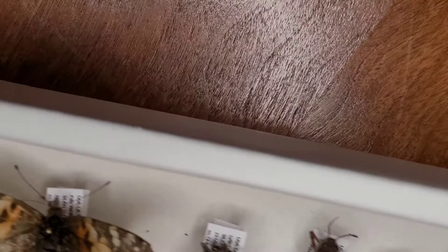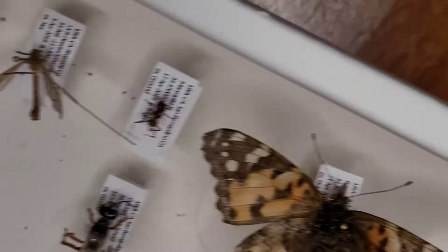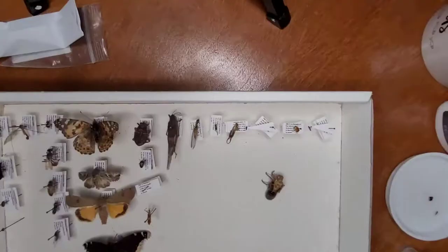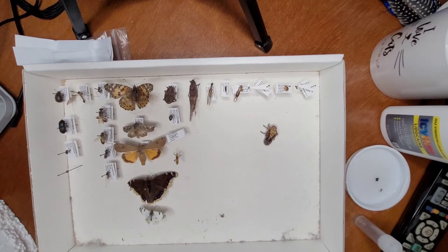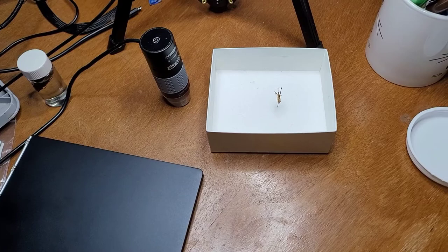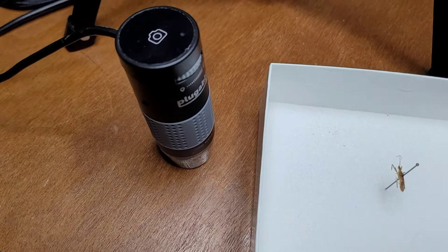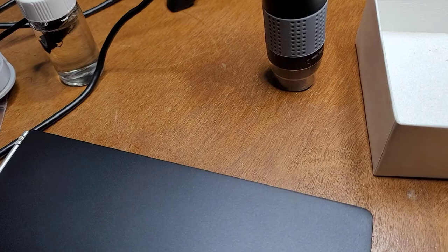These are organized by order and then alphabetically by family — we'll be getting into some of that coming up real soon. For identification purposes I've gone ahead and pulled this out of the box and put it inside a little case with some foam on the bottom. This is the USB camera I'll be using, connected to my laptop. It's not the best camera but it will allow us to get a much closer look at the insect to examine the details.